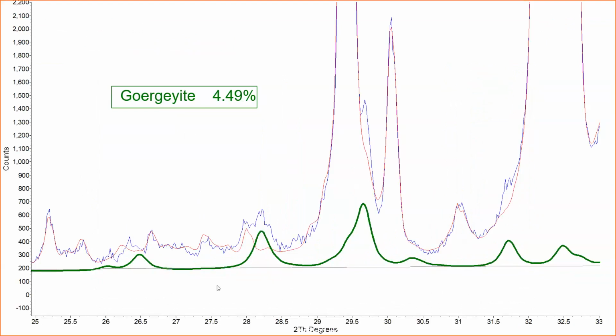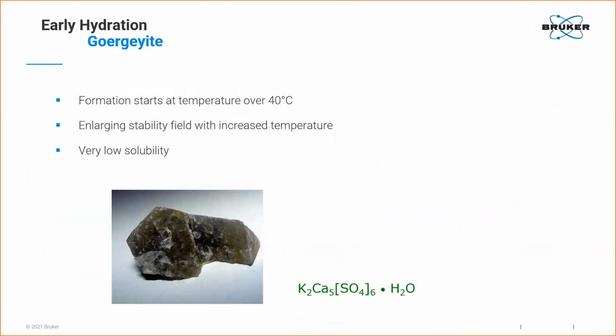So what I'm showing here, this is a Rietveld plot, where the red curve here, this is the calculated diagram, while the blue curve, this is the actual measured diagram. And in this case, during the calculation, I did not consider görgeyite. That's the reason why you see here a difference between measured and calculated. But I showed here the intensity contribution which would be related to görgeyite. So we clearly see that this missing intensity here is easily explained by this phase. So also such a phase, görgeyite, can be easily detected and distinguished in the diagram.